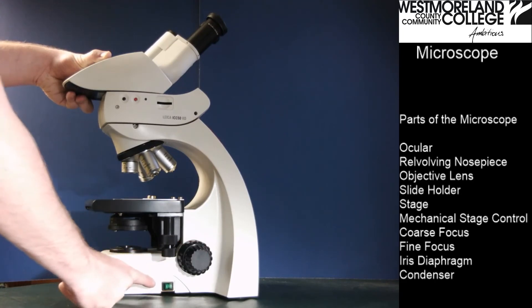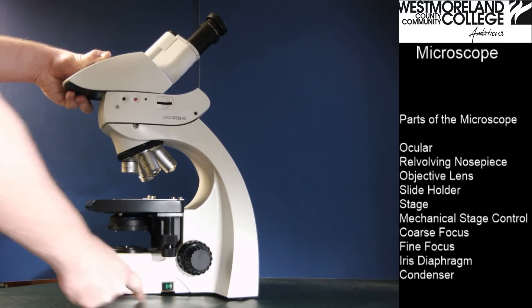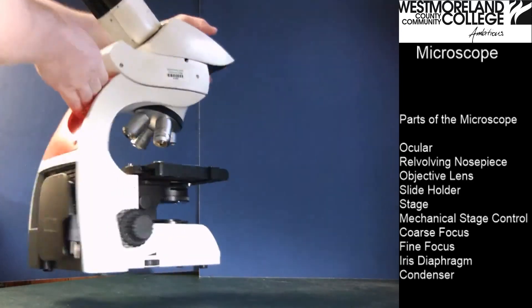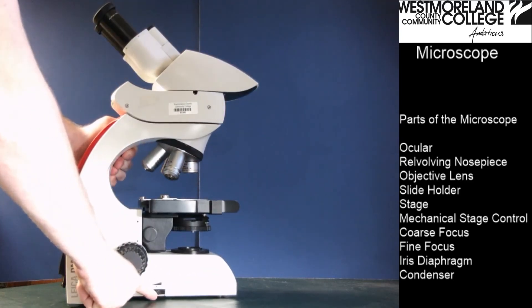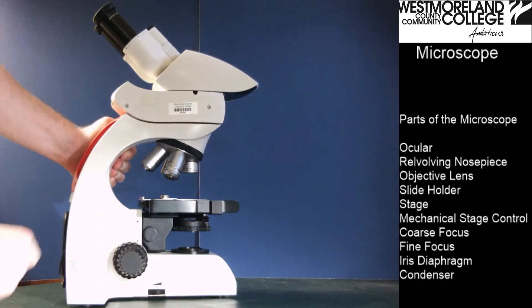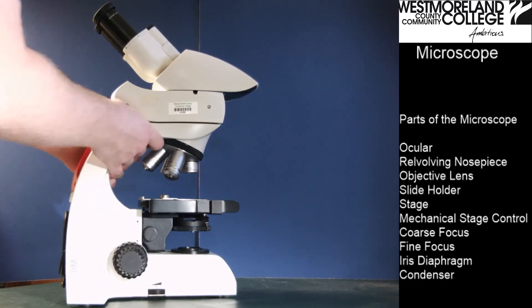We can see the power button on this side. And on this microscope, on the other side, there is a way to control the light intensity — a wheel to increase the light strength.